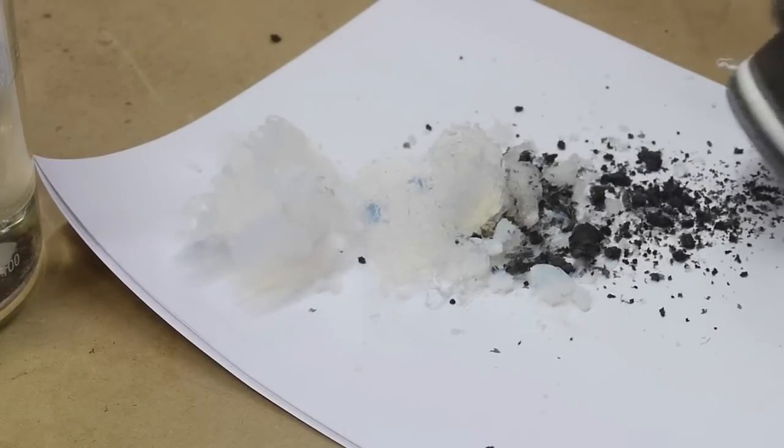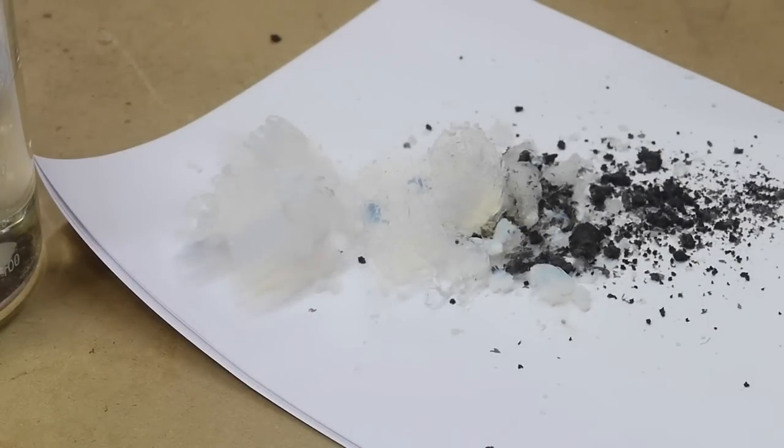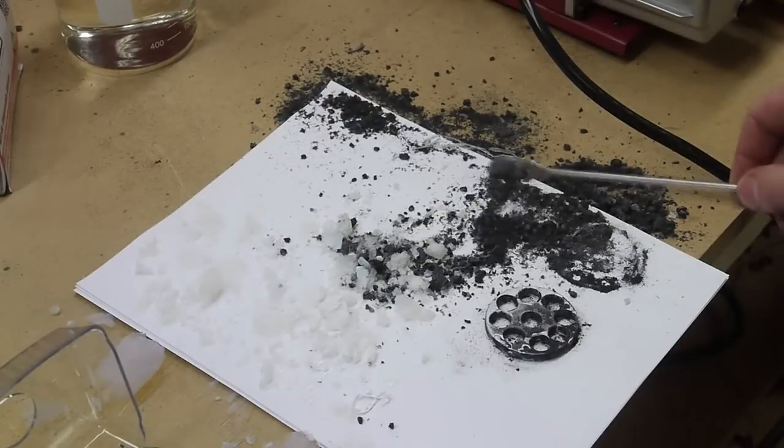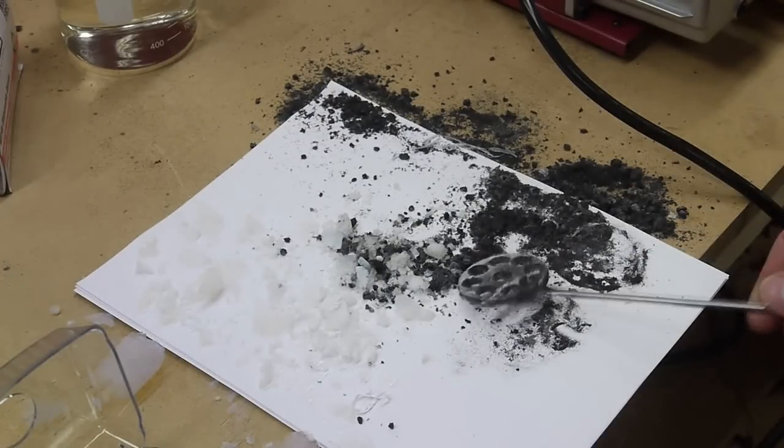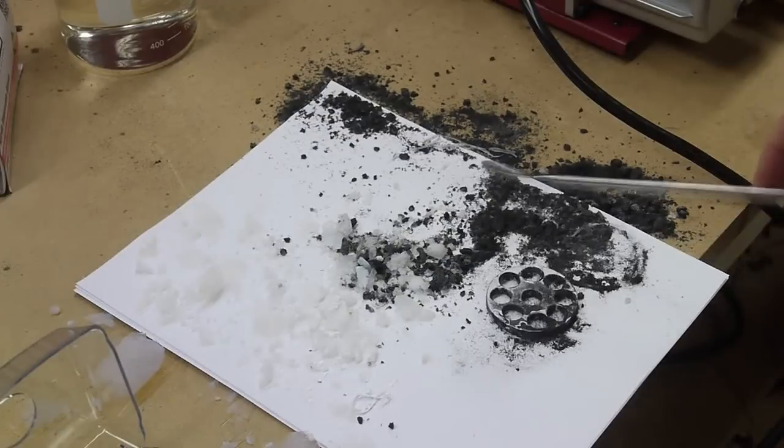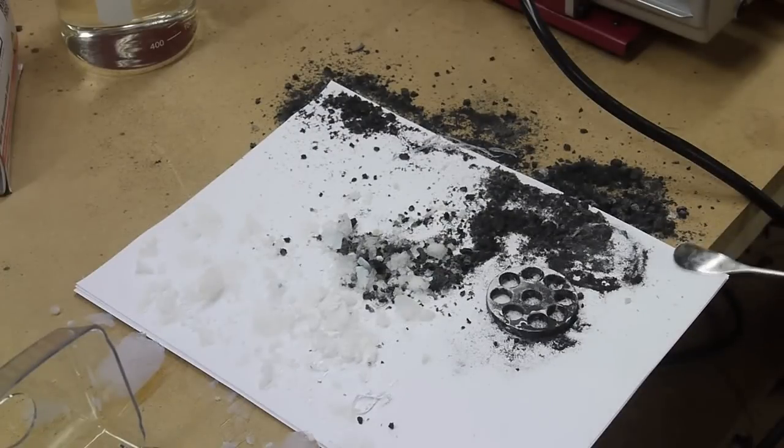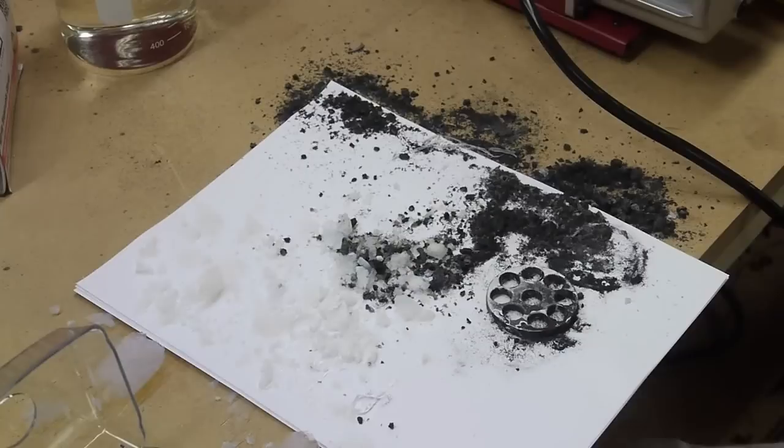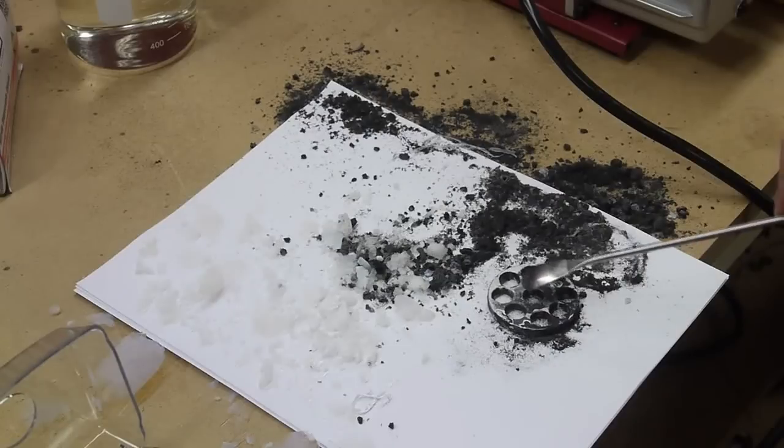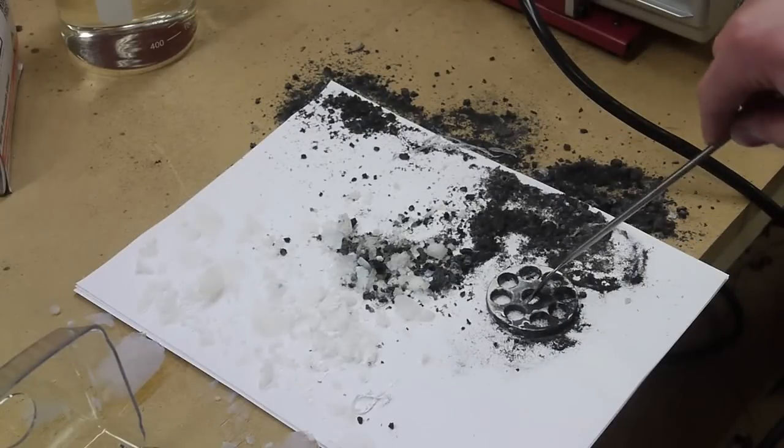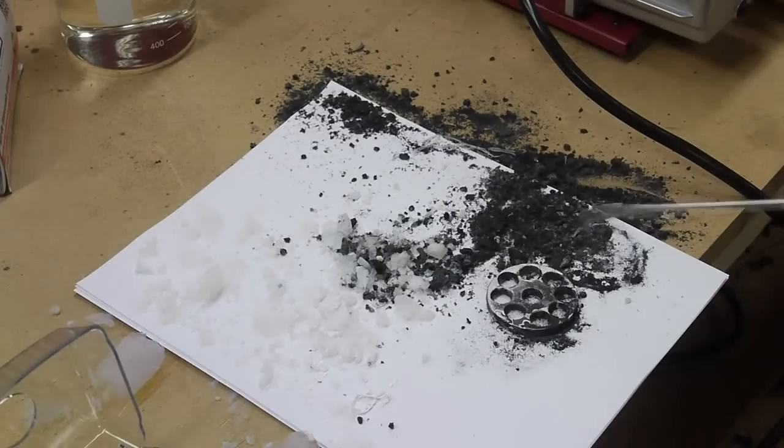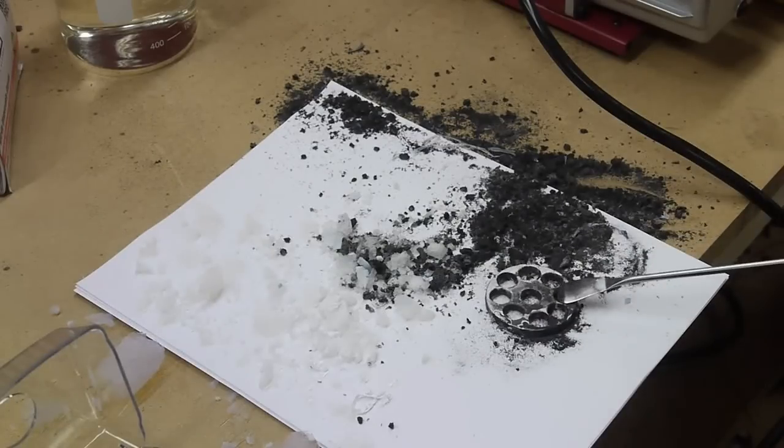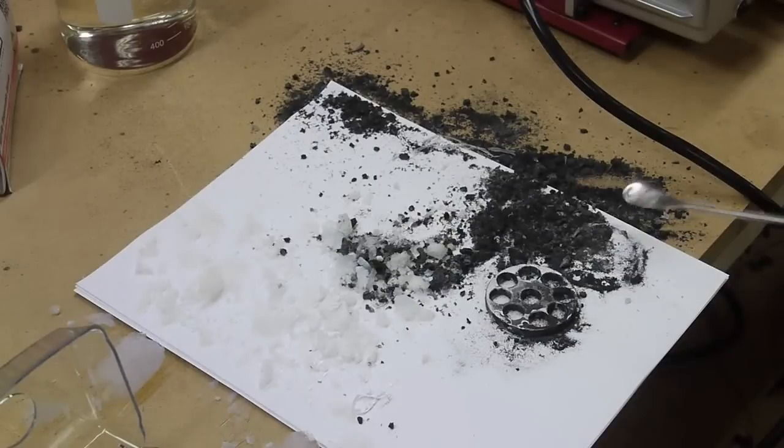And what I had done is I had put this aluminum spacer into the bottom so that the aerogels that were sitting on the bottom of the chamber wouldn't fall down into the valve that's at the bottom. So I don't know what's going on here, but apparently aluminum reacts with supercritical methanol. I think I'm pretty sure that I put a piece of window screen inside here to cover up these holes, just aluminum window screen. And it's gone.